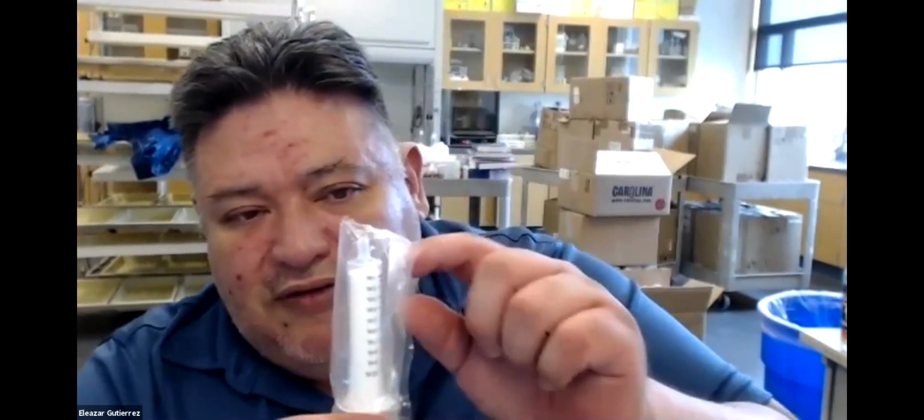Your author tells you to do it about 2 or 3 times, and you know that you're successful when your leaves fall to the bottom. That means that all the gas has been extracted out of the leaves, and there's no reason for them to float anymore, and they're going to fall to the bottom of your syringe. Okay, so you're going to do one at 0.24.